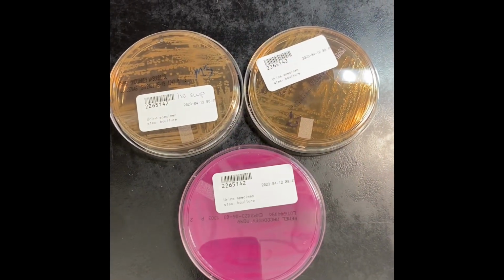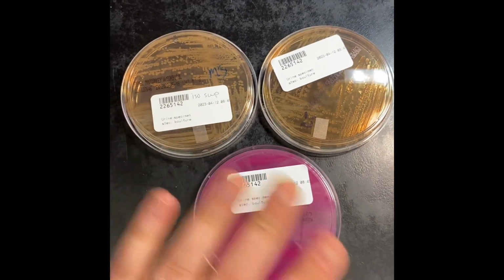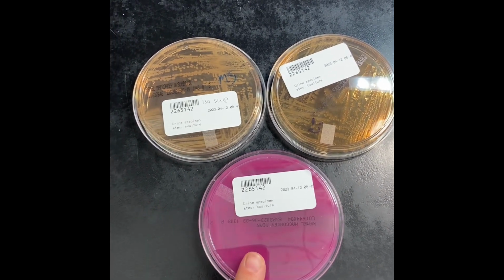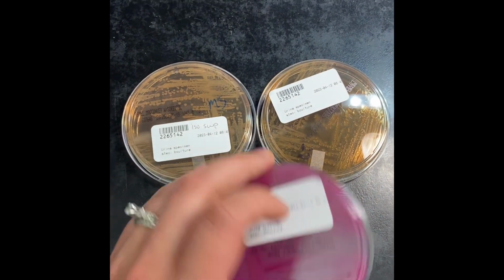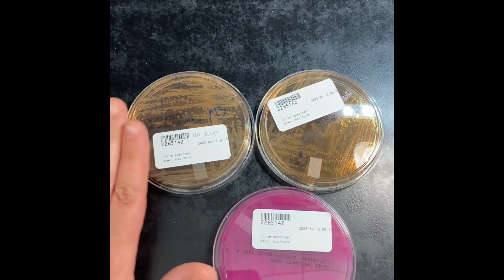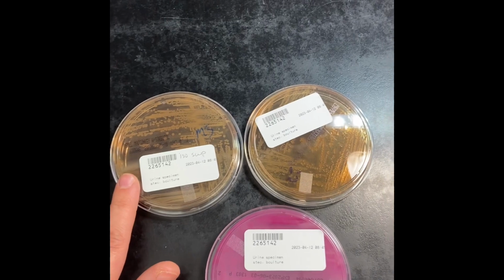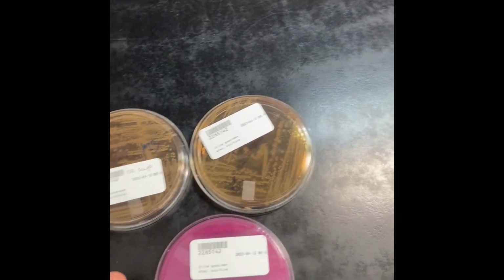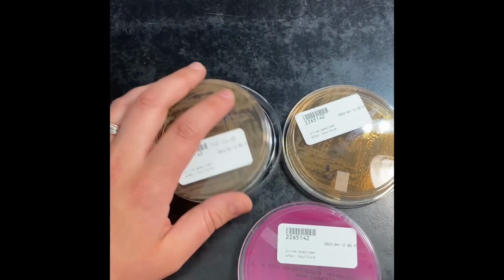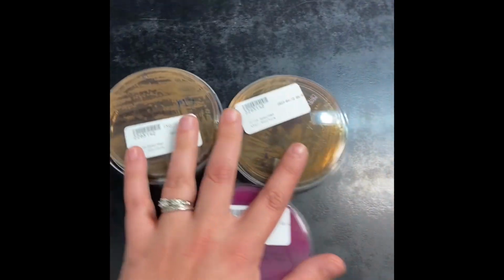Here's an example of some plates that have been cultured and grown. This here is an E. coli O157 sample, and you can see that on a standard MacConkey plate, the growth is pink, but we do use plates with more selective chemistry in them, such as this MacConkey sorbitol CT plate. Don't remember what the acronym for that is. And it is clear on the MacConkey sorbitol plate, indicating that this is an O157 sample.